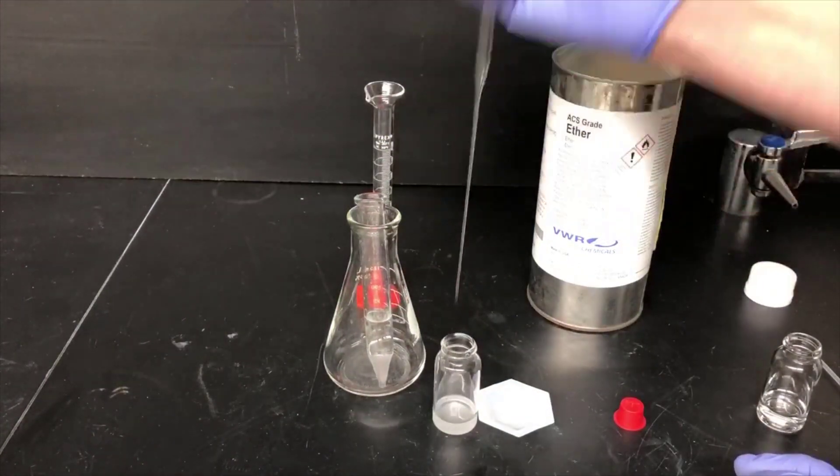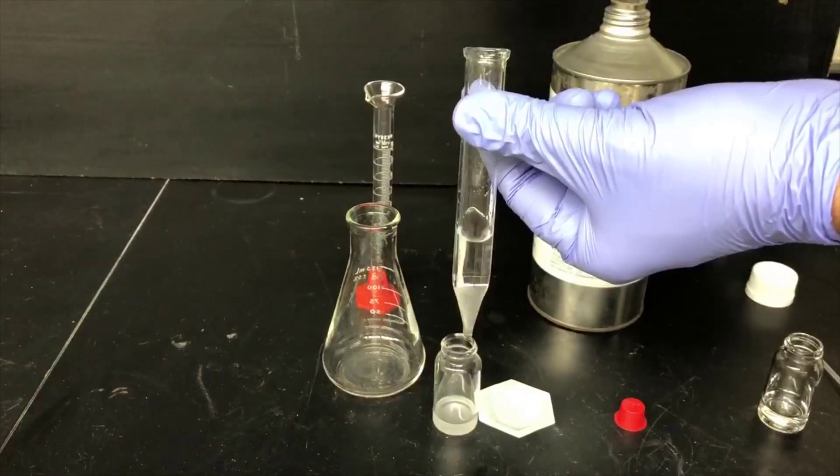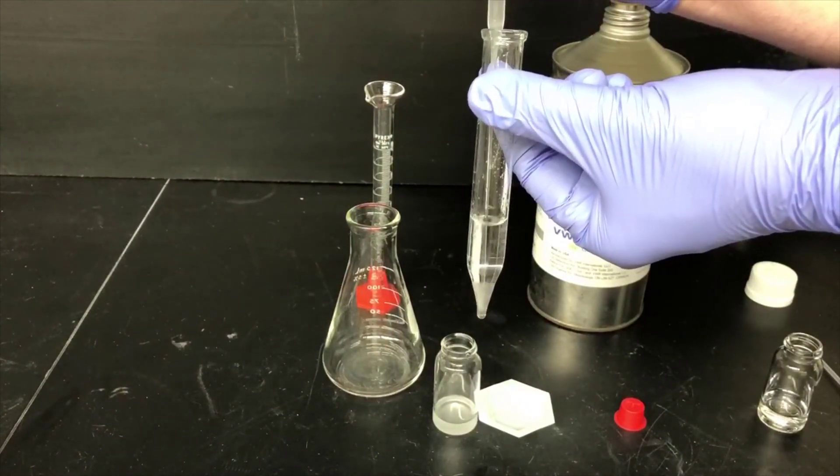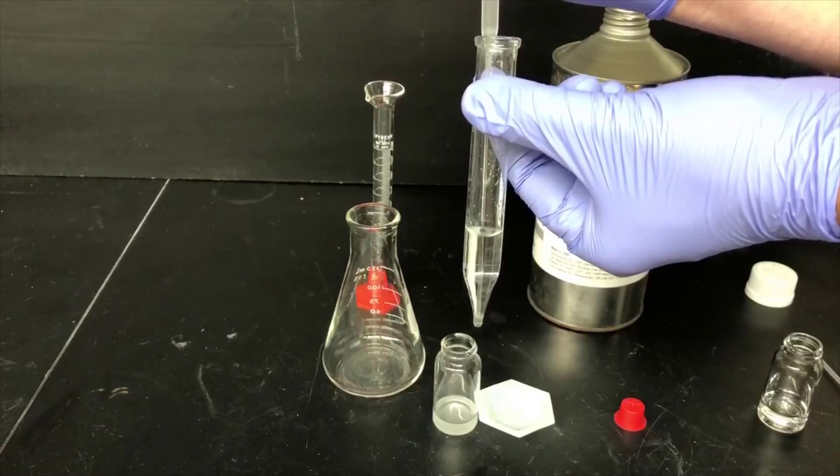You just have so much more control sucking out the bottom layer than you do trying to separate a top layer from a bottom layer. Here I'm sucking out the last few drops of that bottom layer.